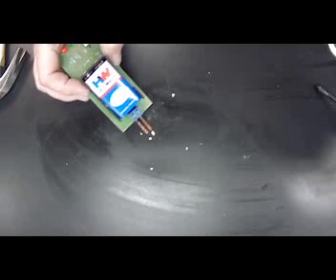So let's get our conductivity meter in here. Don't really want to touch sulfur. And we'll put it on there. And again, no light, so it does not conduct electricity. And it shouldn't, it is a non-metal. All right, I'm going to clean this one up. Ooh, there we go.